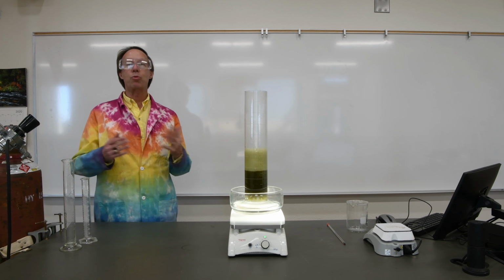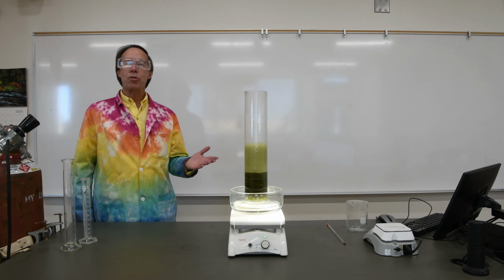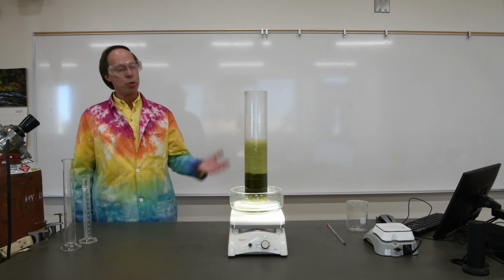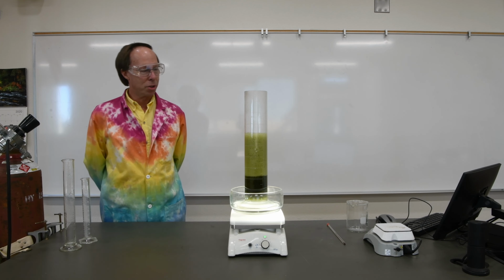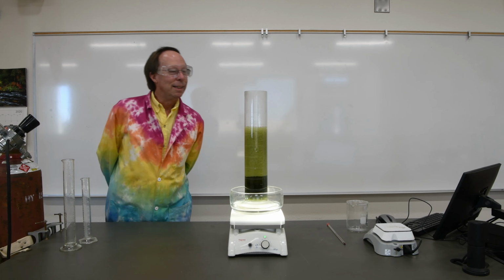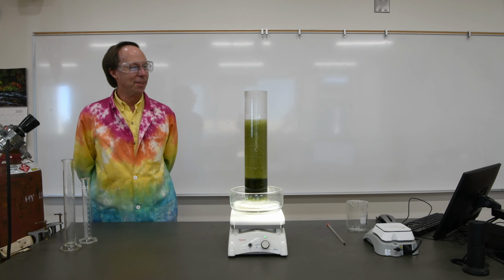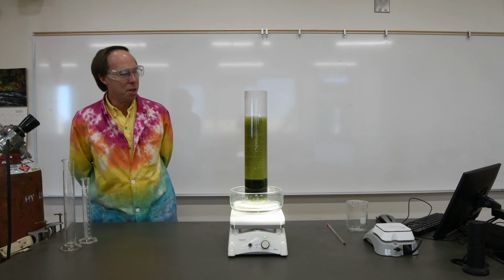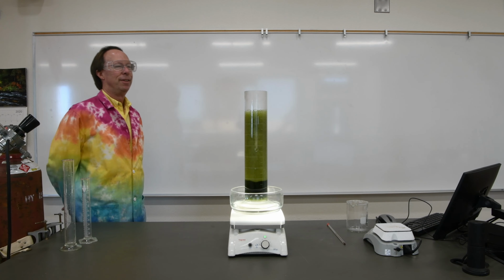That's the form it takes while it's helping the chemical reaction along. Once the reaction is done, of course, the cobalt should return to its original form, and we'll be able to tell that by watching the color. So now it's reached that peak, lovely green color. It may make it over the top, but I may have just planned things perfectly. We may get close, but not quite go over, because the reaction should be done pretty quickly.